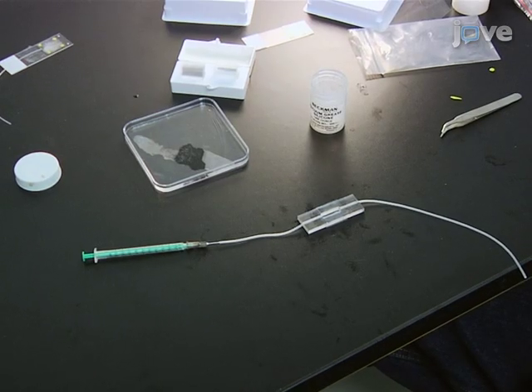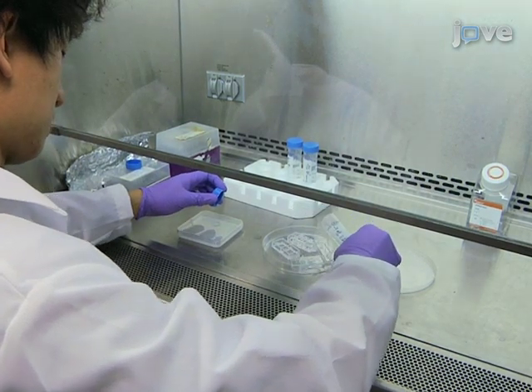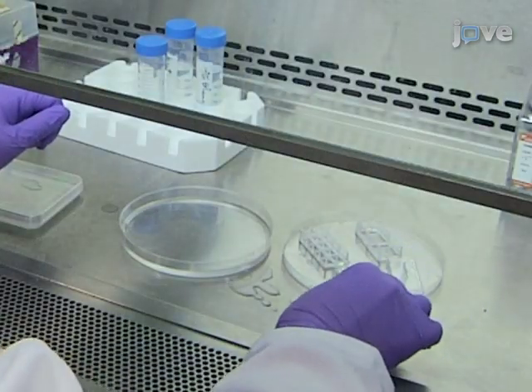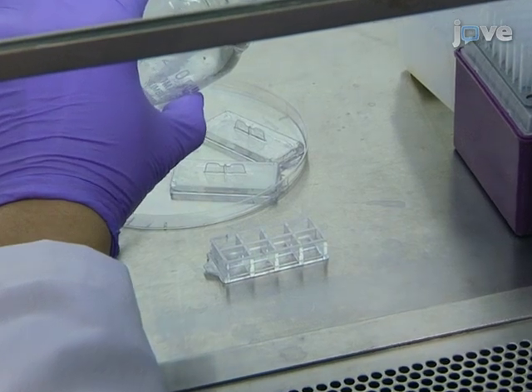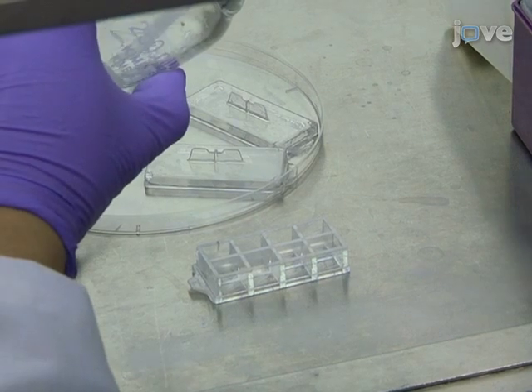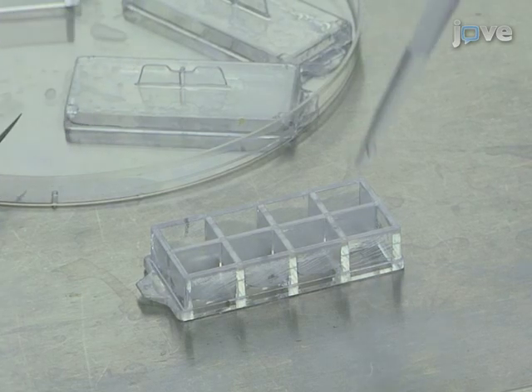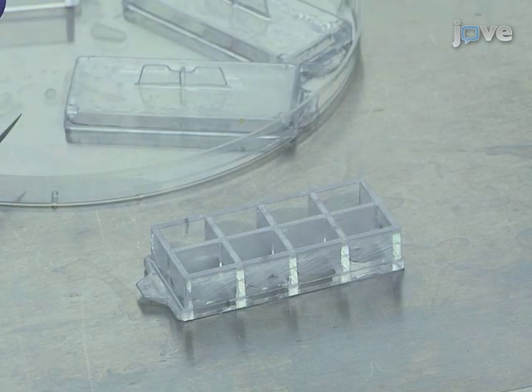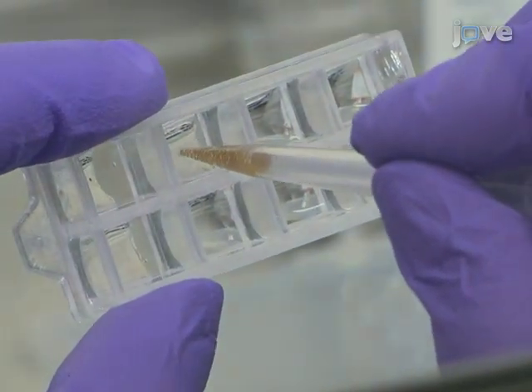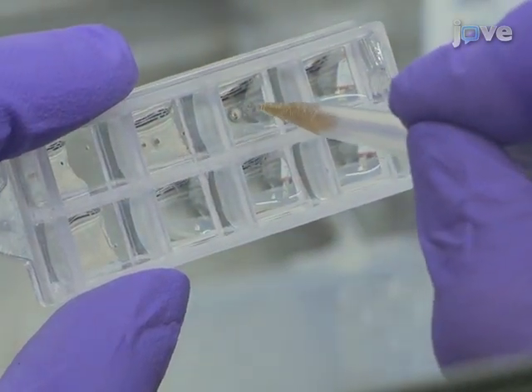To prepare an imaging chamber with a chambered cover glass, first, sterilize the chambered cover glass with 70% ethanol and leave it in the hood until dry. Add 0.6 milliliters or 0.2 milliliters of full-strength MS medium containing 1% sucrose and 0.5% phytogel into each well of a 2-well chamber or an 8-well chamber respectively. Then, sterilize the seeds and sow them directly on a chambered cover glass containing a thin layer of clear gel and let them grow vertically for 5 days.